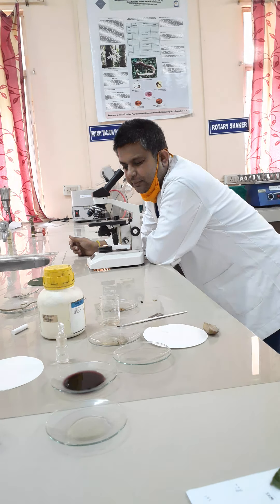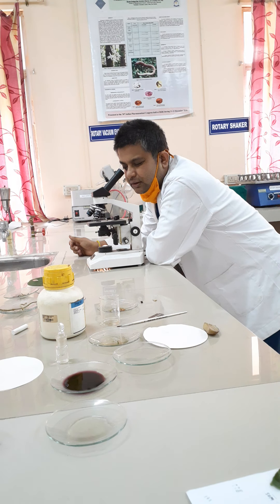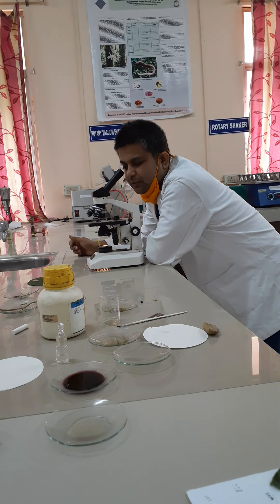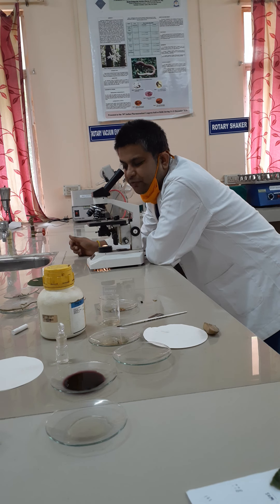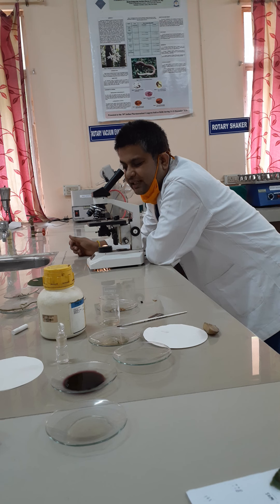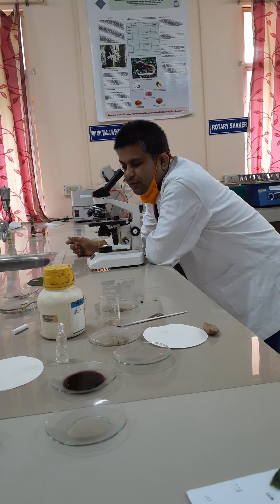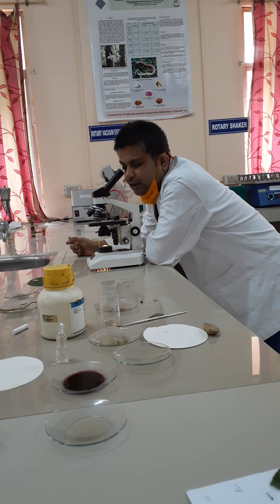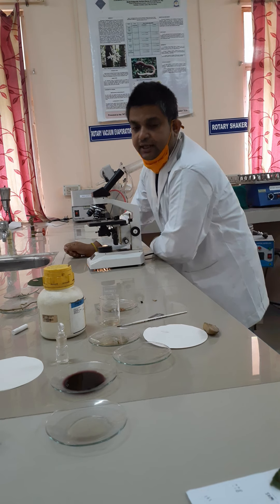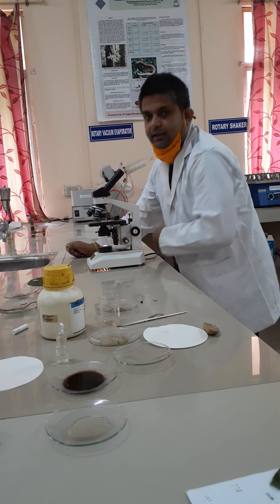To summarize: the epidermal part consists of unicellular covering trichomes, followed by the mesophyll. In the midrib region you will find the alternate arrangement of xylem and phloem parenchyma, which together is known as the vascular bundle. These are the various characteristic features of the senna transverse section. Thank you.